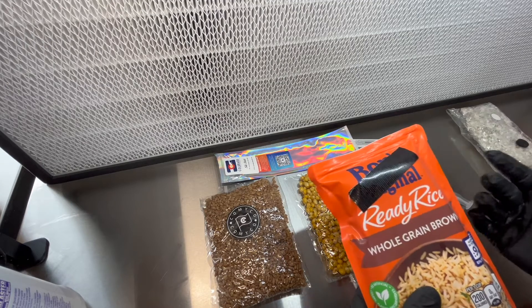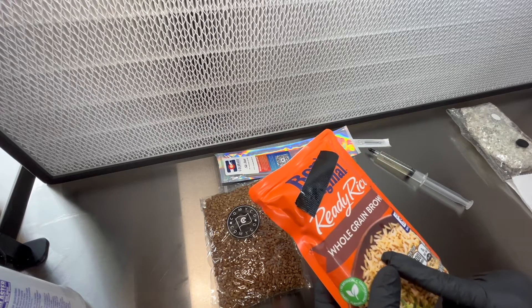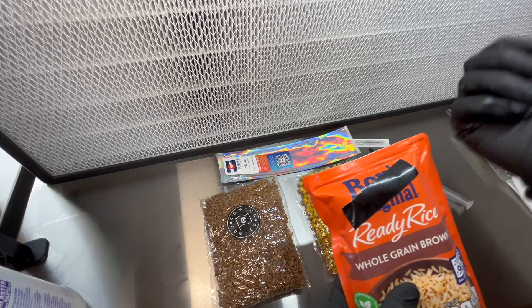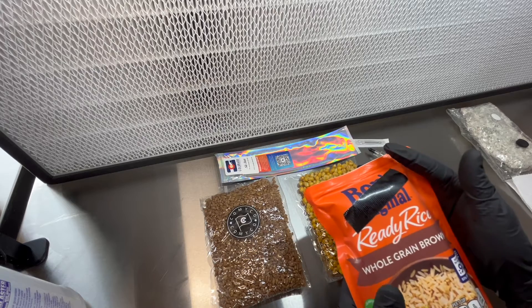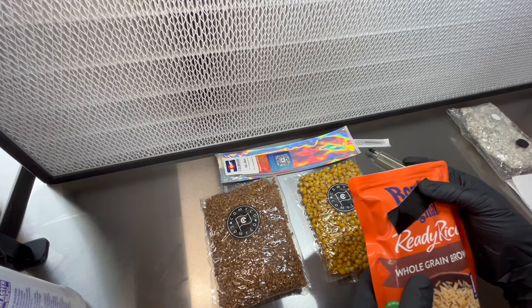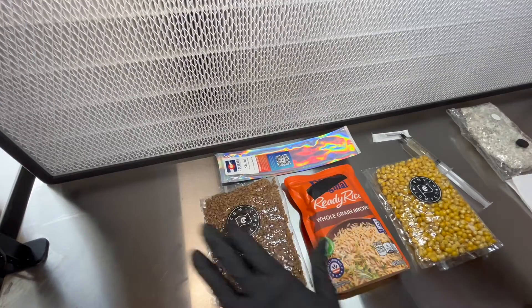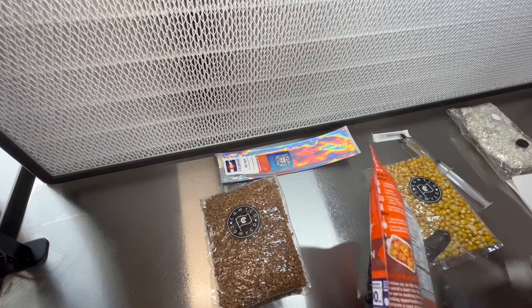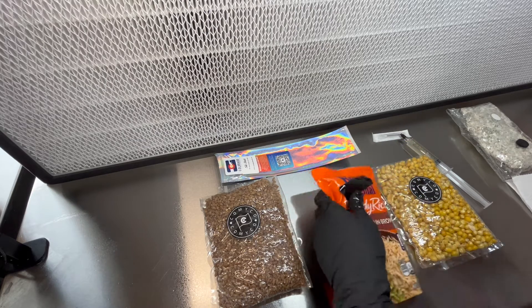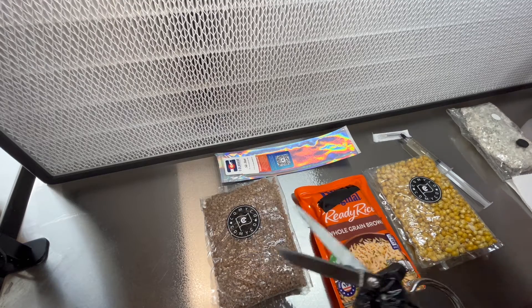You've got to cut this thing open, which for demonstration purposes — I'm not going to run this flow hood here, and most people don't have a flow hood — so it's pretty clean in here. None of the air in here has been moving, so we're going to do all this in open air. What you've got to do is either stab into the bag with the needle and cover that with tape, or cut this corner, put your LC in, and then cover that with tape. I'm going to spray the bag again and spray the scissors again. You can't ever use too much isopropyl alcohol in my opinion.